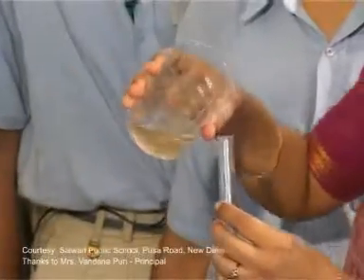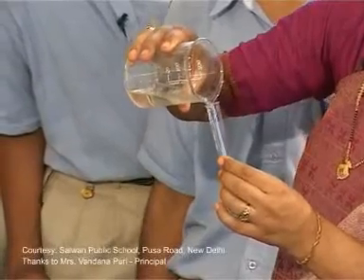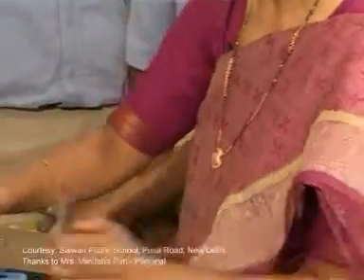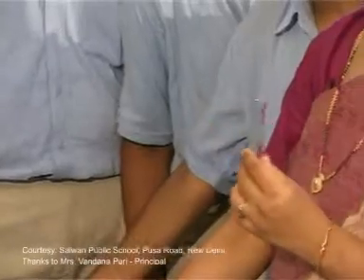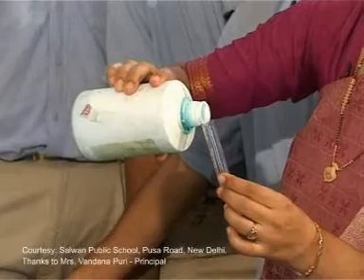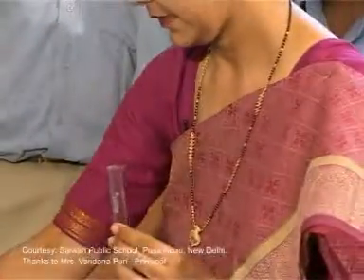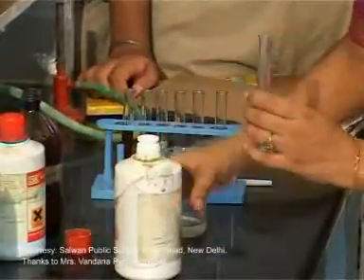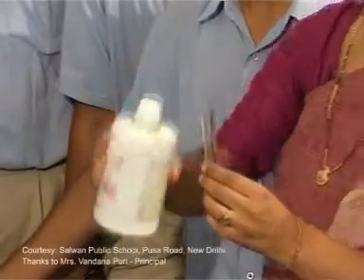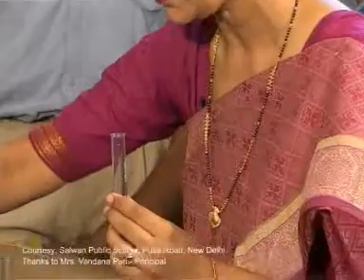Now for the third test, take some quantity of glucose solution and add about 1 ml of Fehling's solution A, which is an aqueous solution of copper sulfate. Also add 1 ml of Fehling's solution B and keep the test tube in a water bath for about 2 minutes.